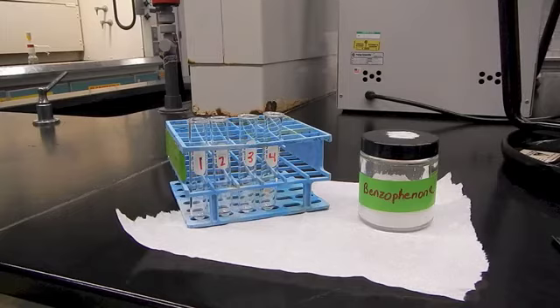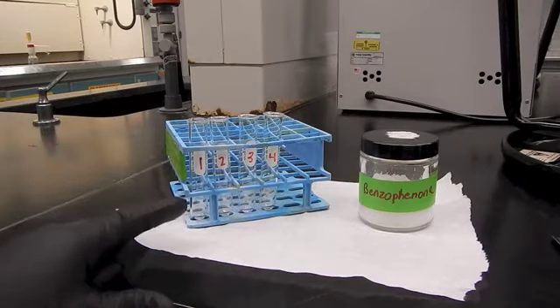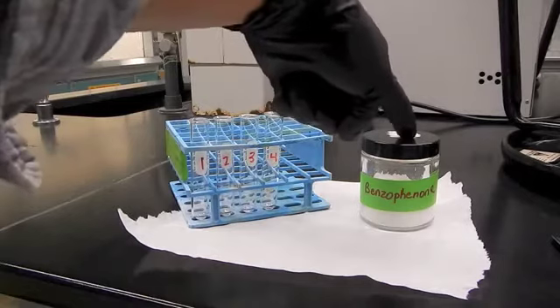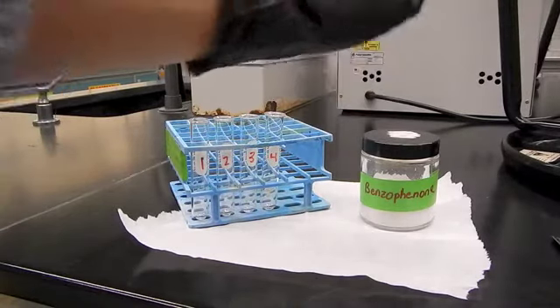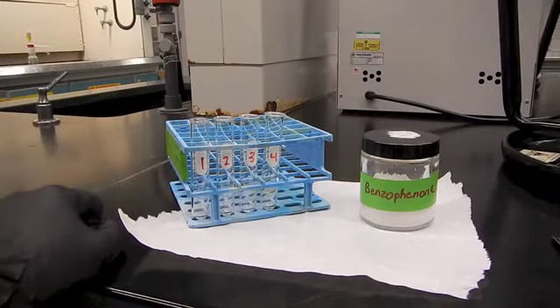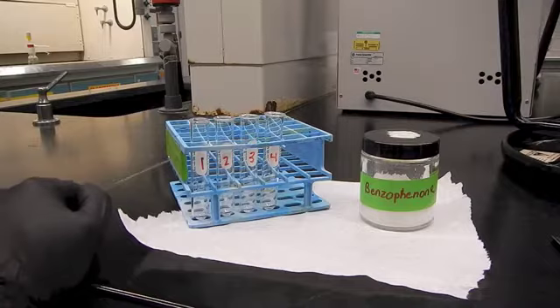On day 2, for part A of the solubility experiment, we're going to have 4 clean and dry test tubes. So if you keep your same test tubes from day 1 and make sure that they're clean and dry, you'll be set to go on day 2. Basically what we're going to do is put 40 milligrams of benzophenone. You don't have to be exact. If you're off by a little bit, that's okay. But roughly the same amount, 40 milligrams of benzophenone in each one of our 4 test tubes. And then we're going to add different solvents to those test tubes to see if the benzophenone dissolves.